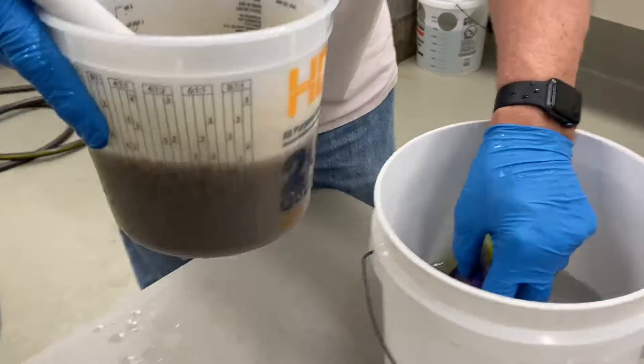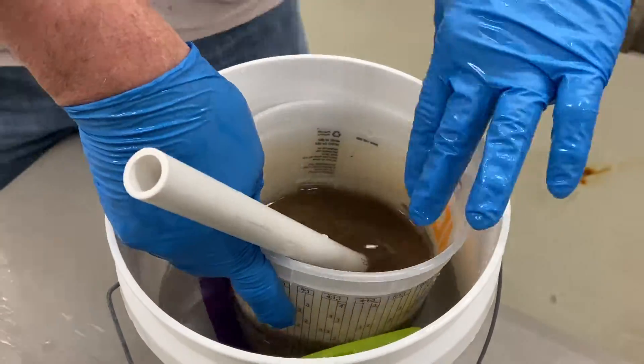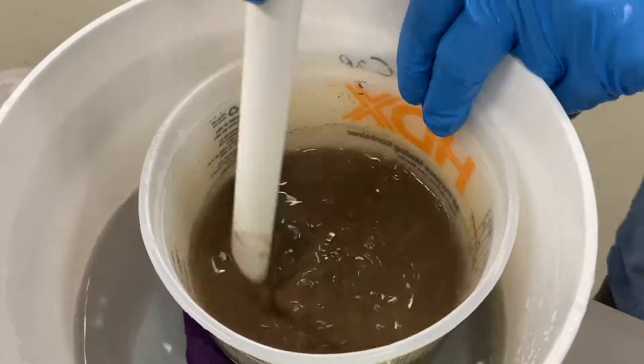I've included clips after one minute, two minutes, and three minutes. You see the color changing, which is the external shell of the artemia coming off.